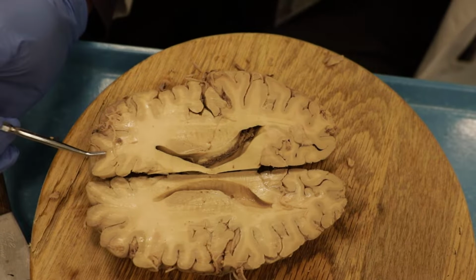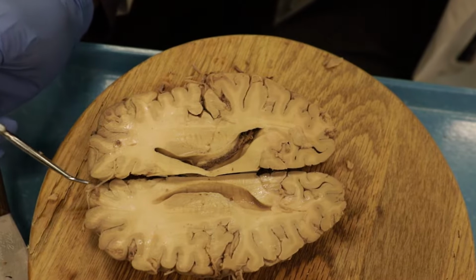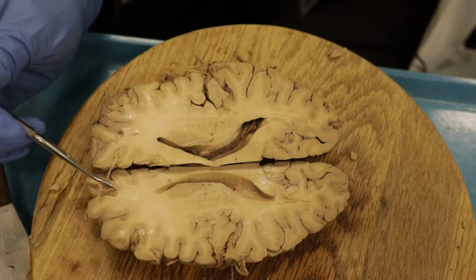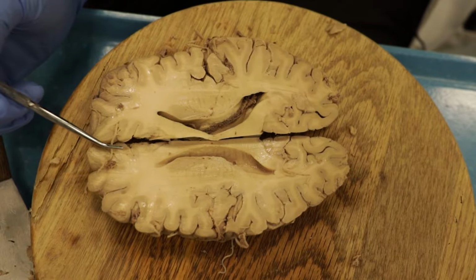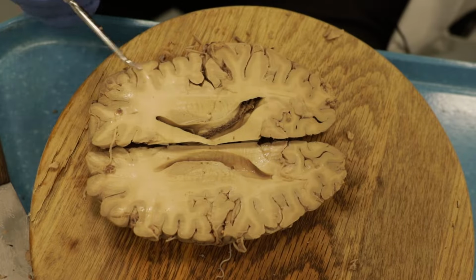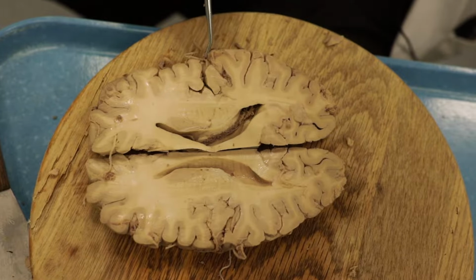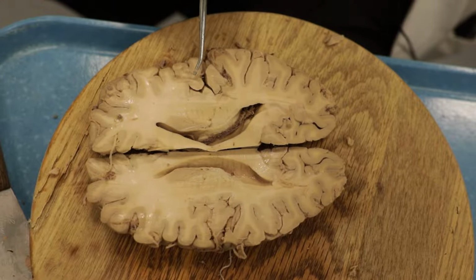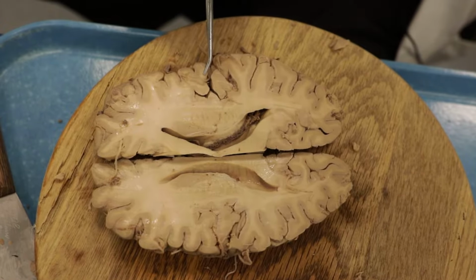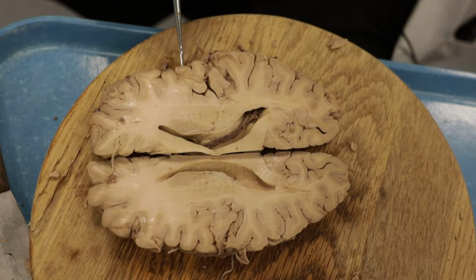So again, any blood vessels you find traveling in this area has to be the anterior cerebral artery. So frontal lobe here all the way back, and this then is the Sylvian fissure. If you see blood vessels coming out in the Sylvian fissure, this has to be middle cerebral artery, supplying the lateral hemisphere of the brain.